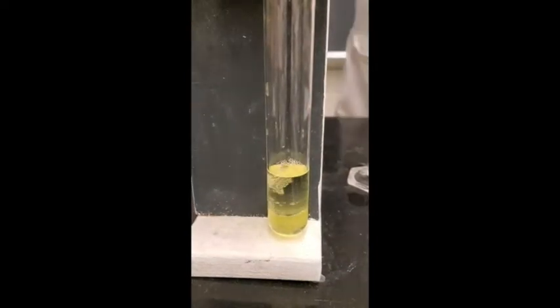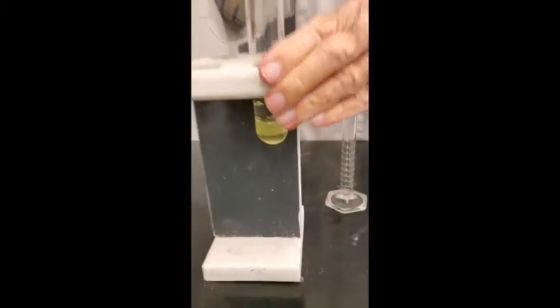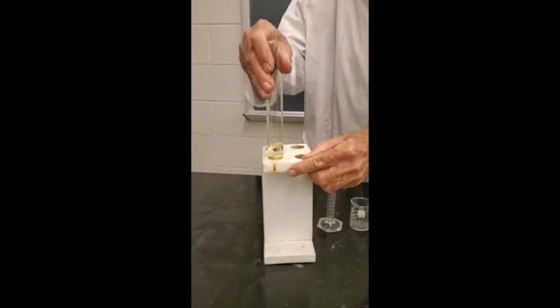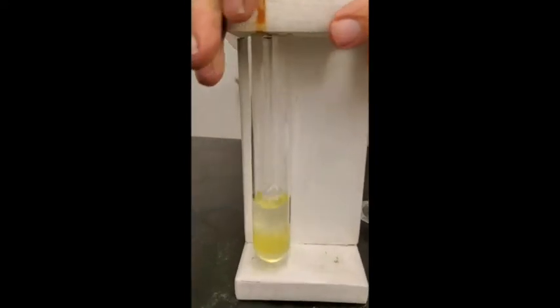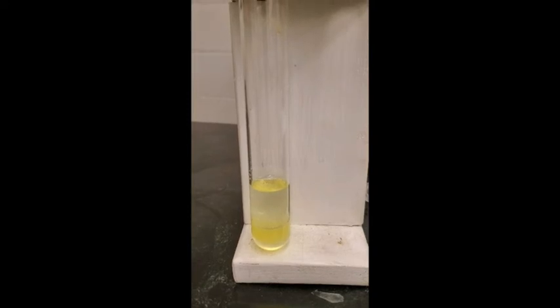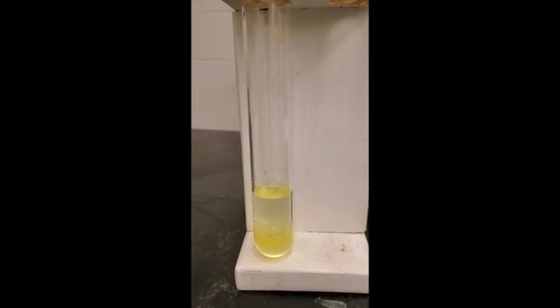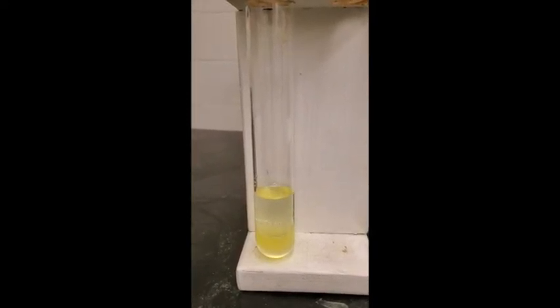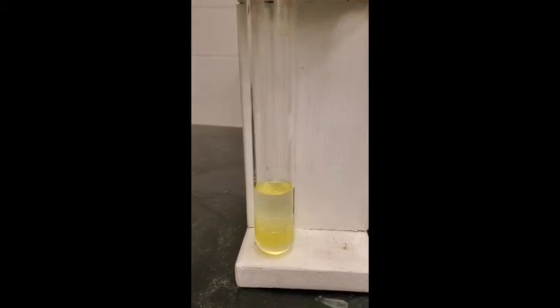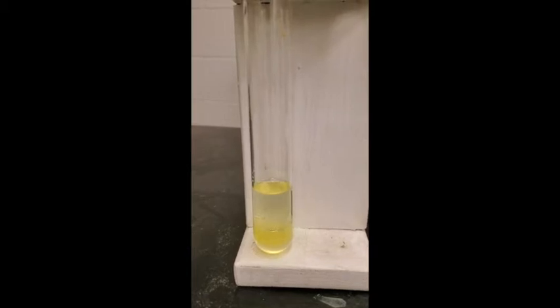Well, let me turn it around because we have the wrong background here. You want to see the color, you have to use the white background, right? There we go. Now, can you see any green in the top? I think you can, can't you? Yep, you can see the green in the top layer, and there's some green in the lower layer too, because chlorine is soluble in both water and in the hydrocarbon.